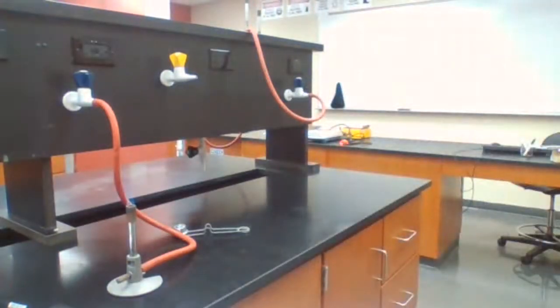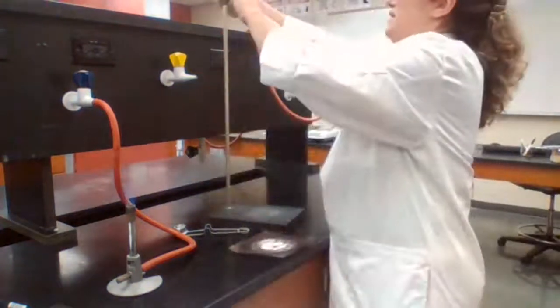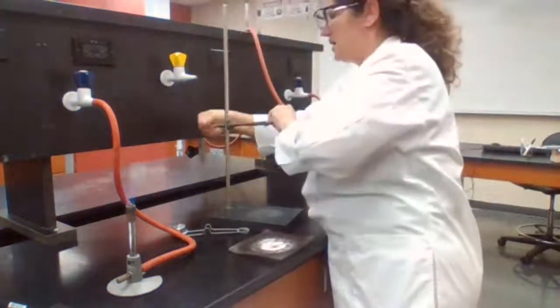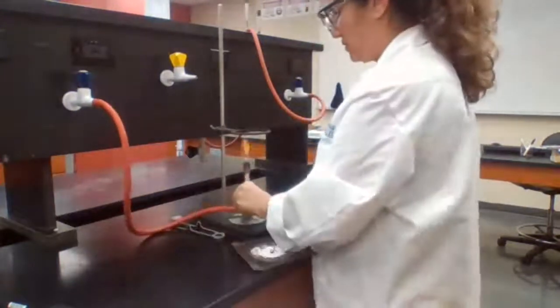So what is it asking me to do here? Set up the Bunsen burner.